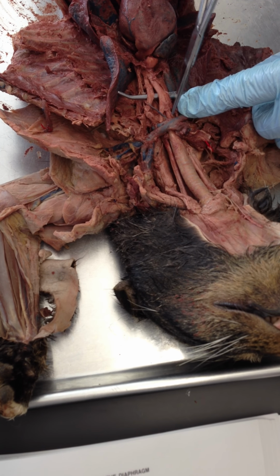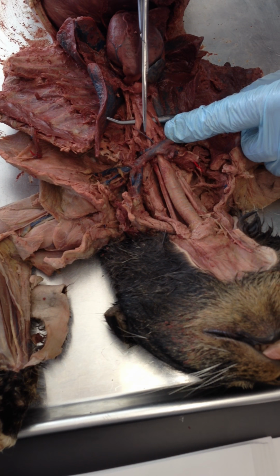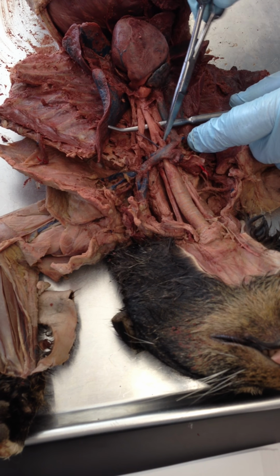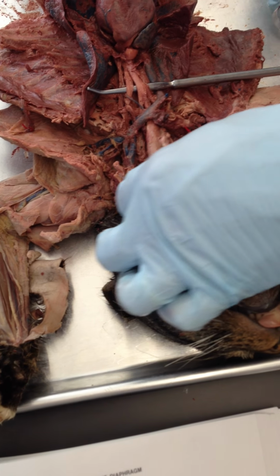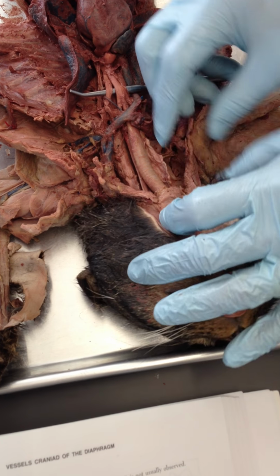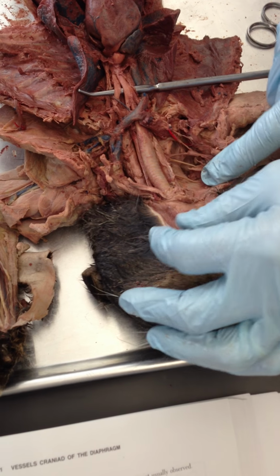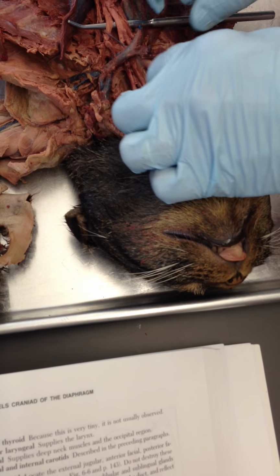Let's see if we can show those. So those two carotids, they parallel each other up either side of the neck. Okay. In fact, the right common carotid right here, this one is continuous if we follow it up here. I know most of these cats have been injected in the right carotid. Yep, right common carotid. Just looking for the injection. I don't see it. Just looking for its extension up here.